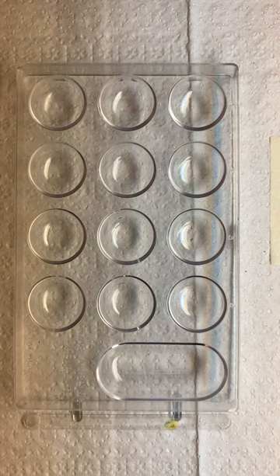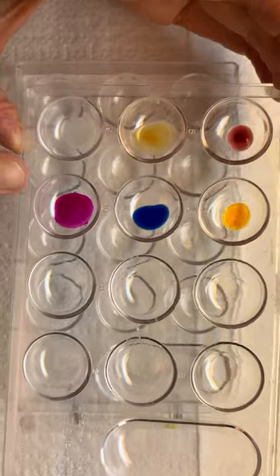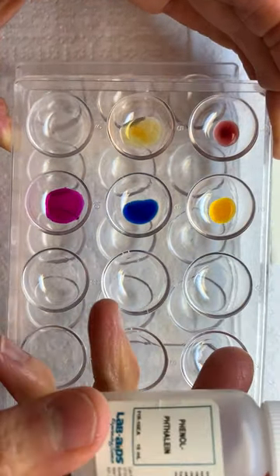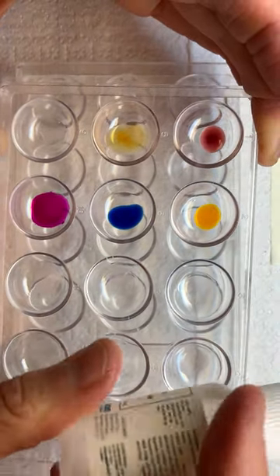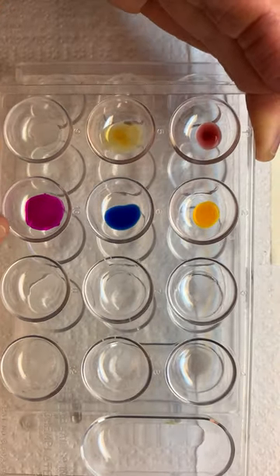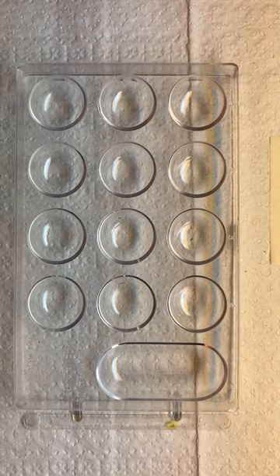And now we're going to test phenolphthalein. You remember in our original test that phenolphthalein was the very last one. Phenolphthalein is this one right here — you remember the color of phenolphthalein is clear. So we're looking to see where there was a change. You can see there was a change at the base end, so let's look at the base end. We're going to do all of them, like the instructions say.